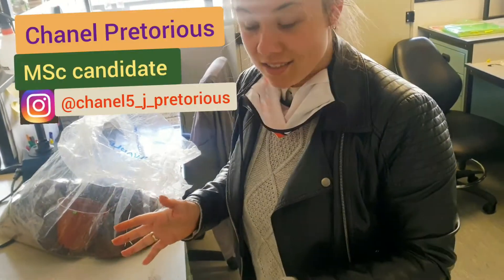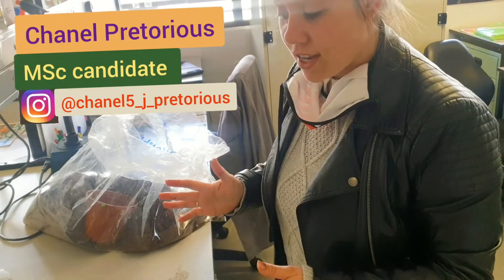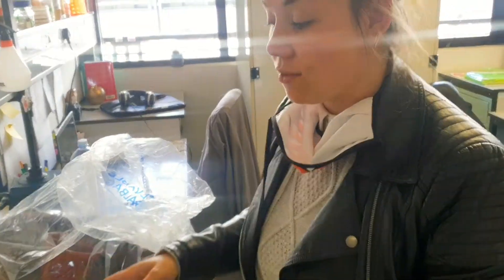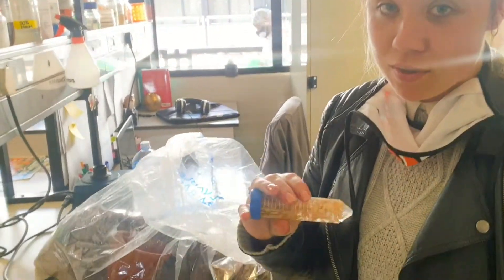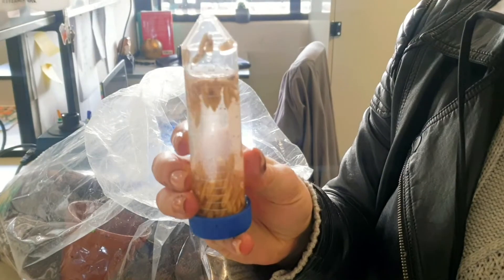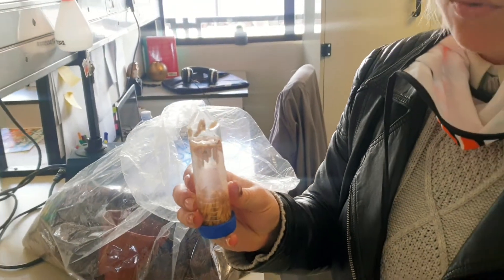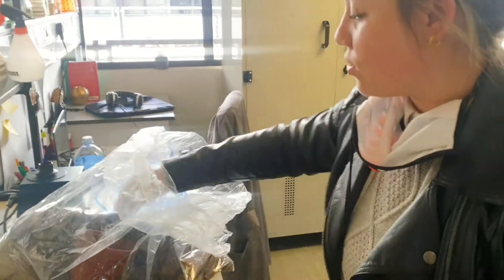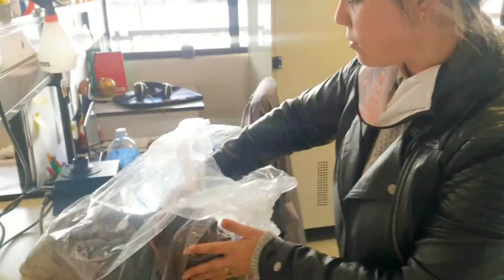This is planting oat seeds. What I do is I just have a tray with some soil, pots, and water, and I have oat seeds that I soaked the day before planting, which just helps them to germinate quicker and to avoid some of the seeds not germinating.